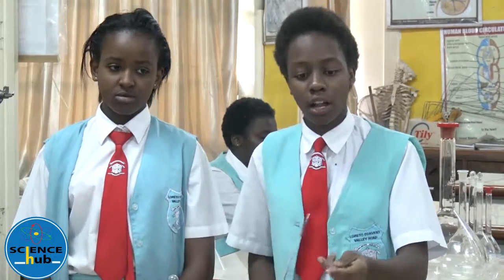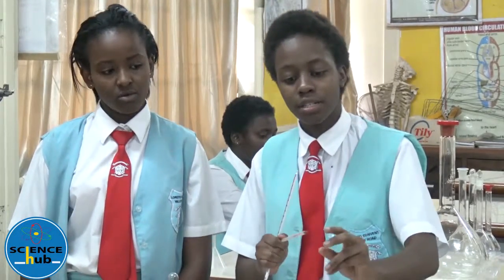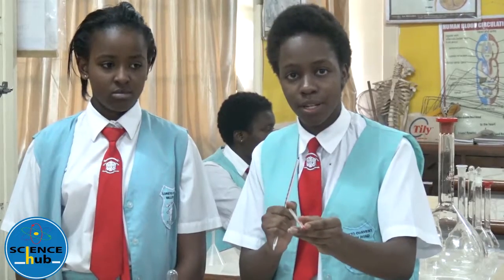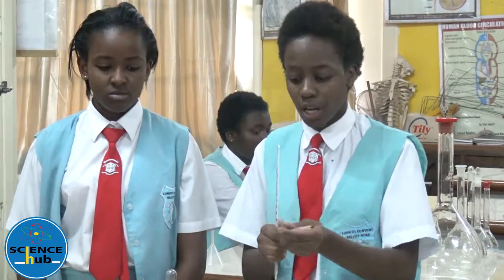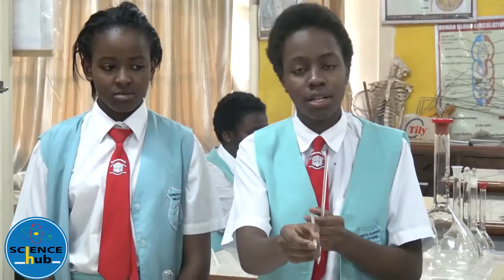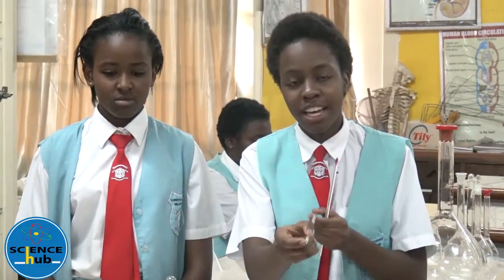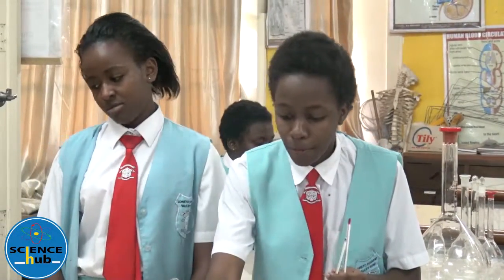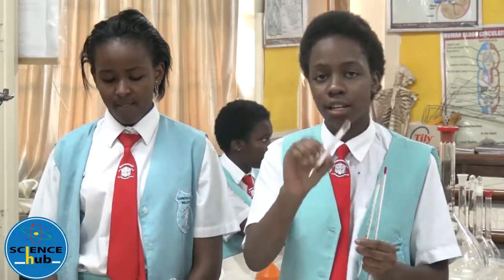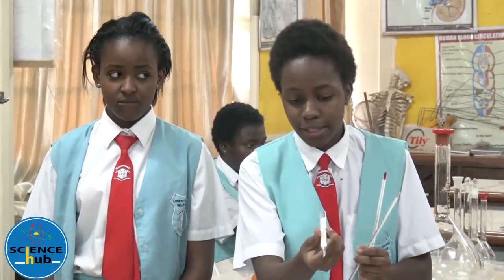This here is an alcohol thermometer — you can tell because of the red liquid inside the thermometer. This is a mercury thermometer — you can tell because of the silver liquid inside the thermometer. And this small one right here is a clinical thermometer which is used in clinics.